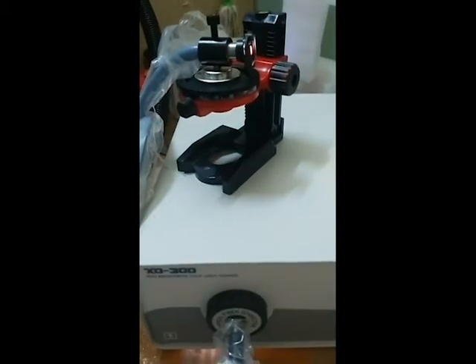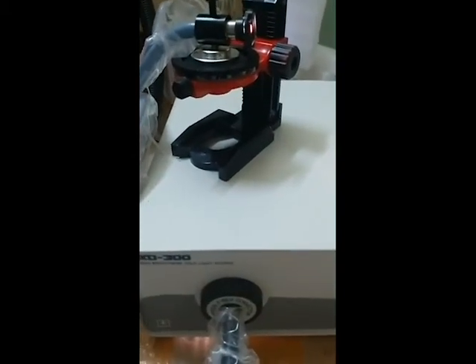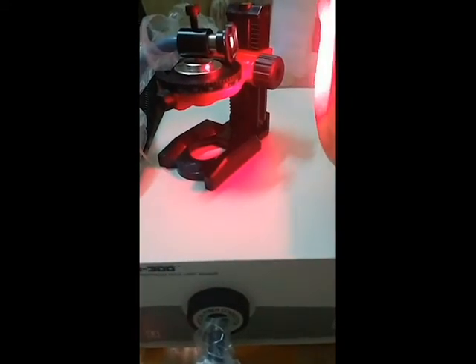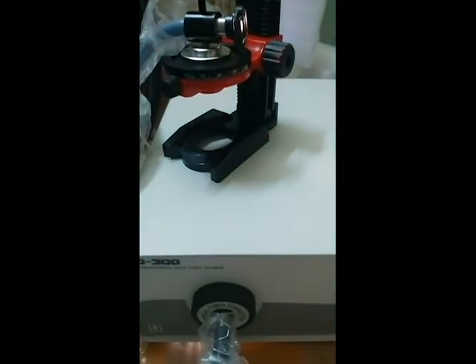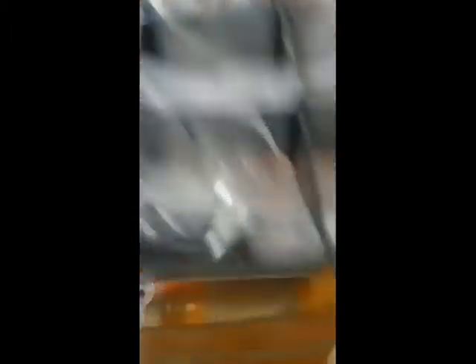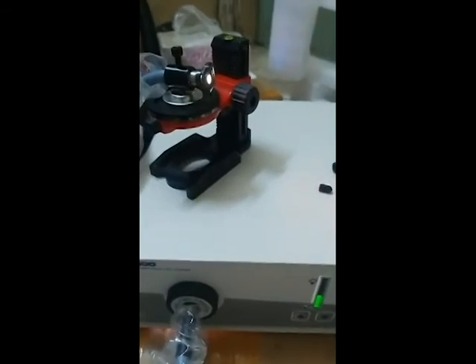You can apply the filters based on your requirements and based on the wavelengths provided in the optical case. The optical case is a black case containing different optical filters. You can install everything by yourself.